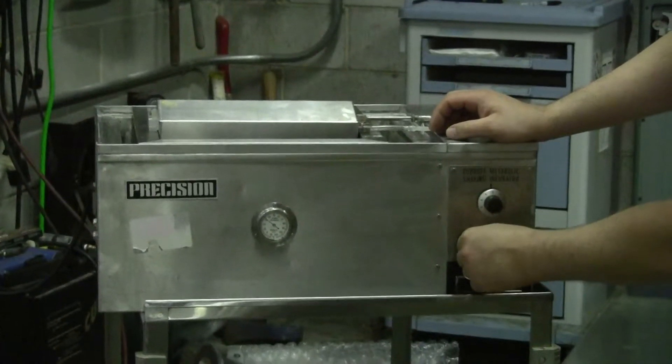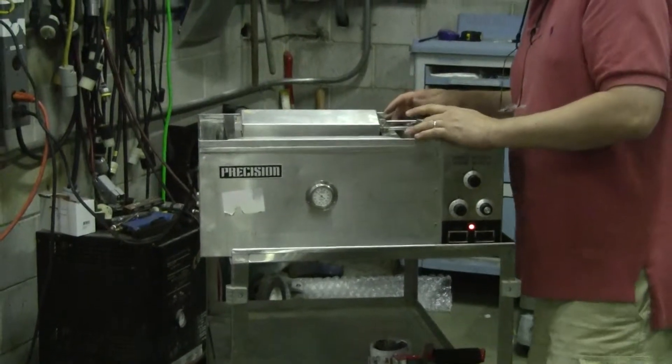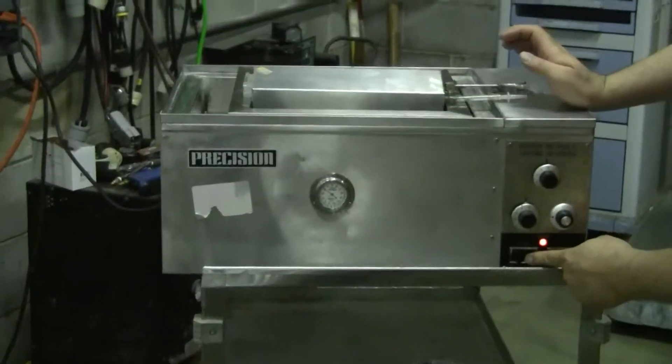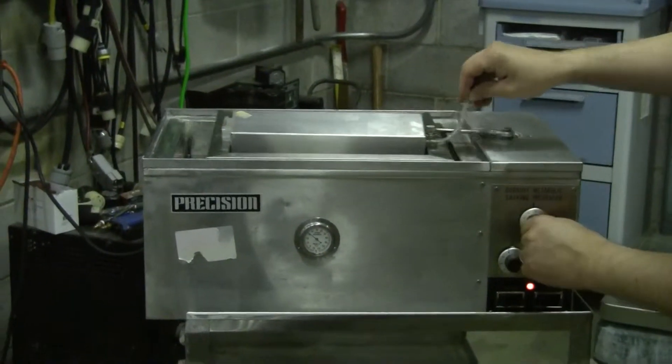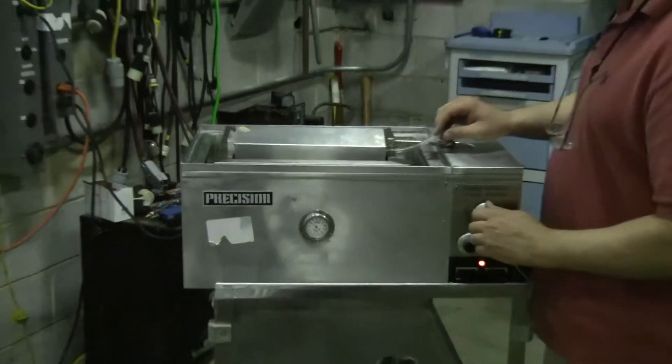You're going to refine your temperature by dialing it in and then looking at sticking your thermometer in it, reciprocating back and forth and changing the speed. It is not an orbital shaker, but a reciprocating shaker.